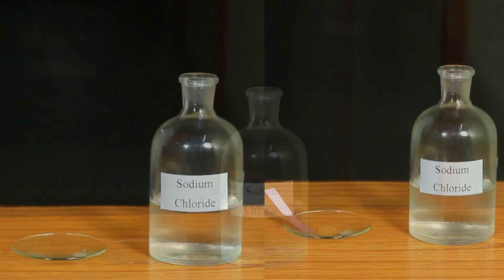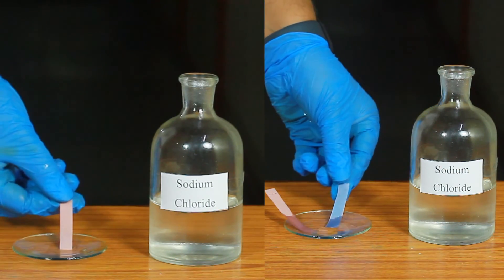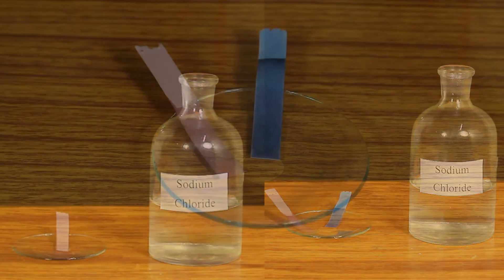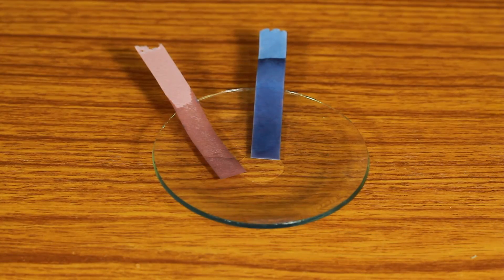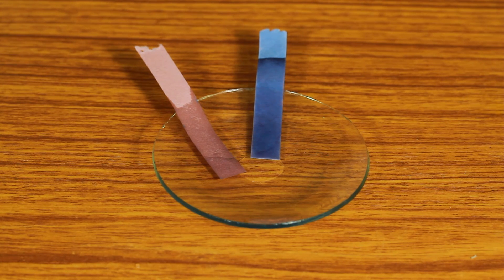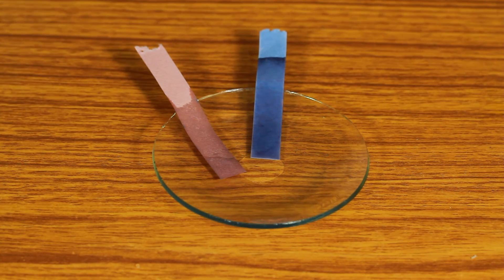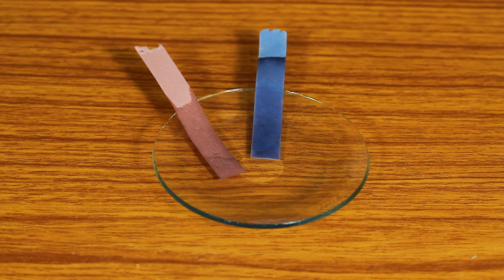Take about 1 ml of sodium chloride solution in a watch glass. Take a piece of blue and red litmus paper and dip it in the solution. Do you observe any change in the color of litmus paper? Sodium chloride solution does not change the color of either red or blue litmus paper.